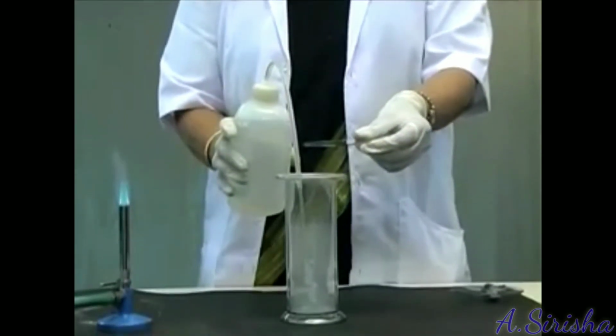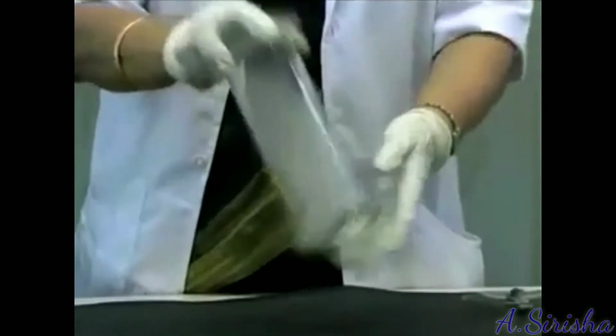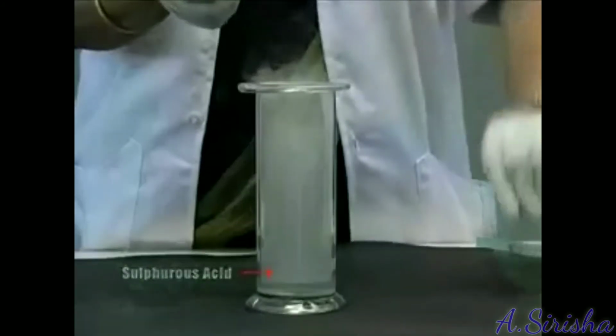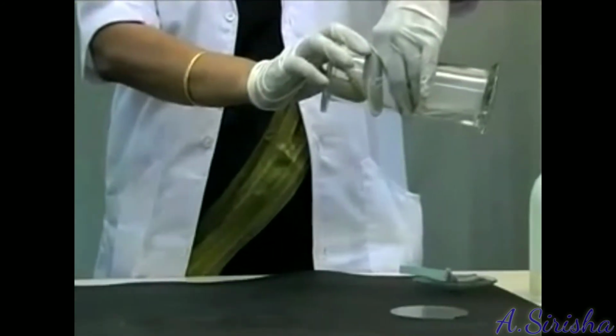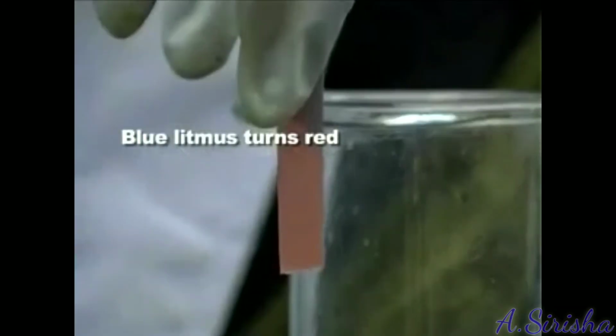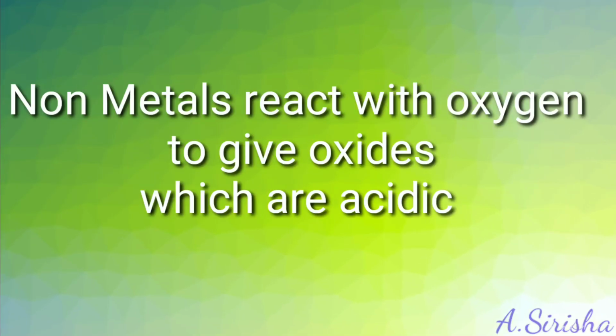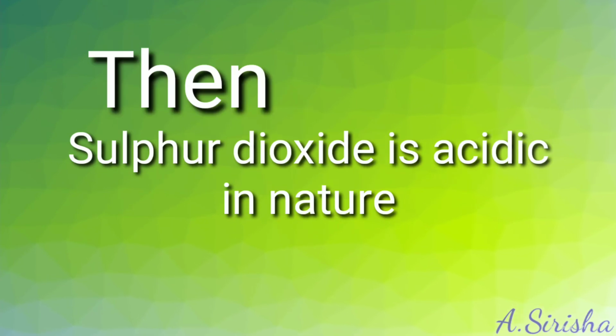Add a small quantity of water into the tumbler and quickly replace the lid. Shake the tumbler well. Test with the litmus paper. The oxide of sulfur turns blue litmus to red. That means sulfur dioxide is acidic in nature. Finally, nonmetals react with oxygen to give oxides which are acidic.